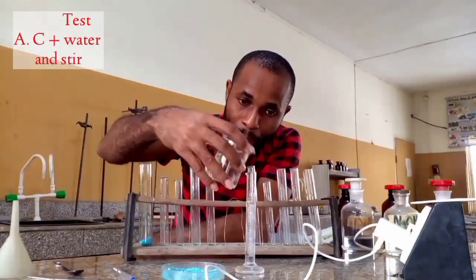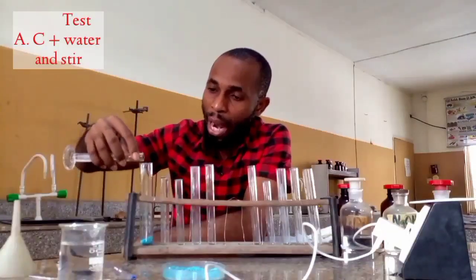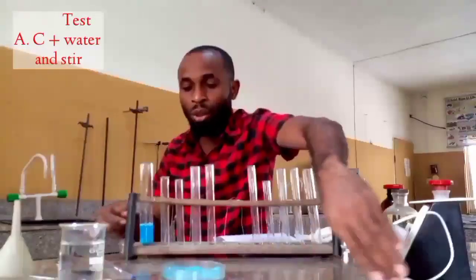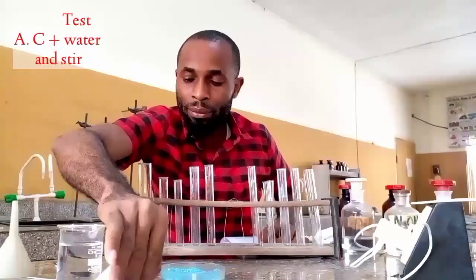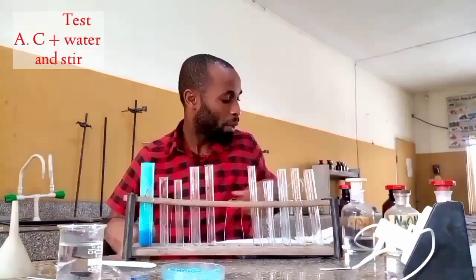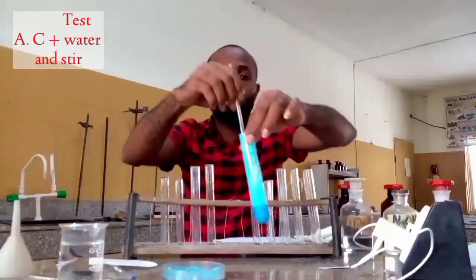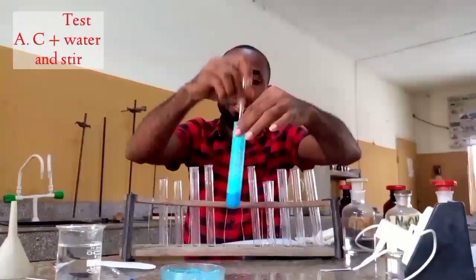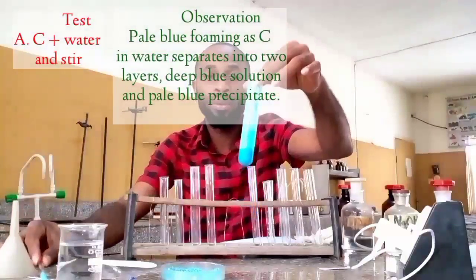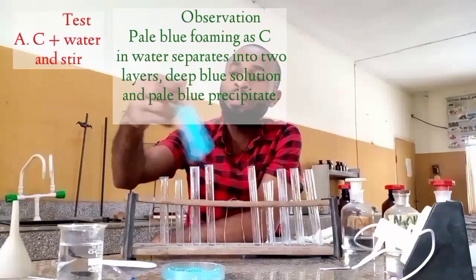Now, they say about 10 cubic centimeters. That means that anything about that 10 cubic centimeters can work for us. Therefore, I add this here. If you look closely, you will see a possible reaction happening. There is a foaming. As you can see, we have two layers. One is showing a pale blue, and the other is showing a deep blue.